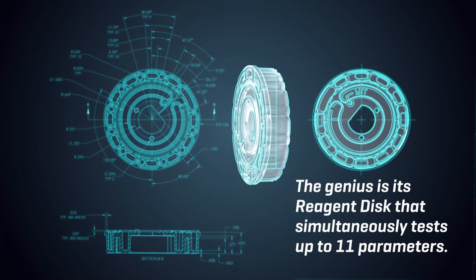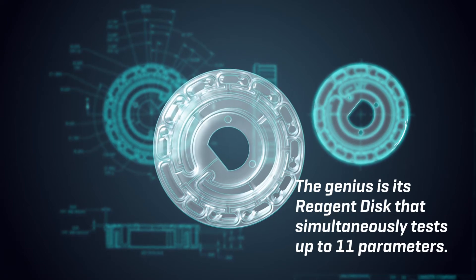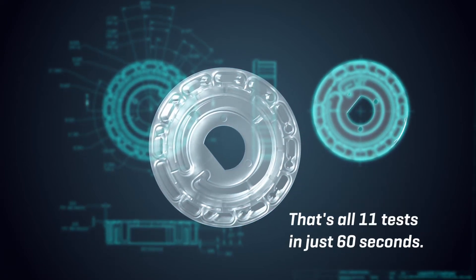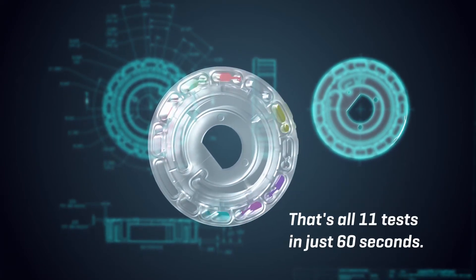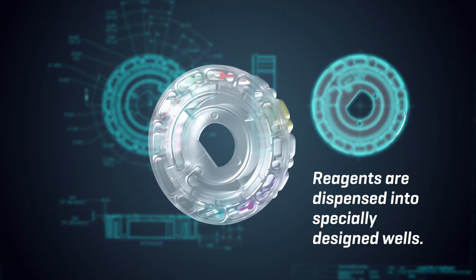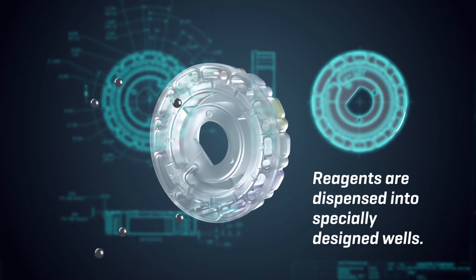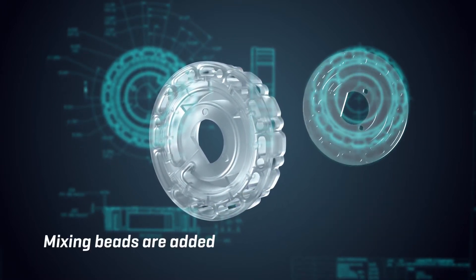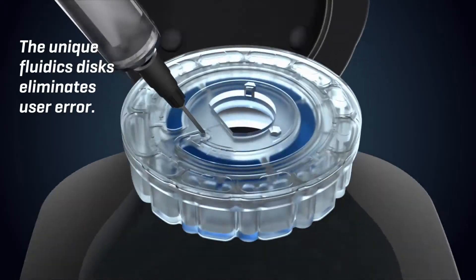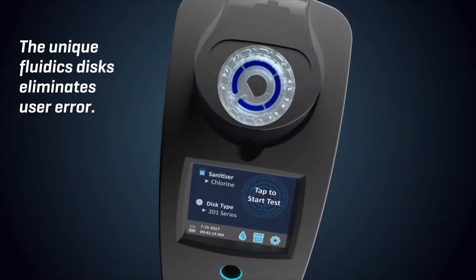The genius is its reagent disk that simultaneously tests up to 11 parameters — that's all 11 tests in just 60 seconds. Reagents are dispensed into specially designed wells, mixing beads are added, and the disk is sealed. The unique fluidics disk eliminates user error.